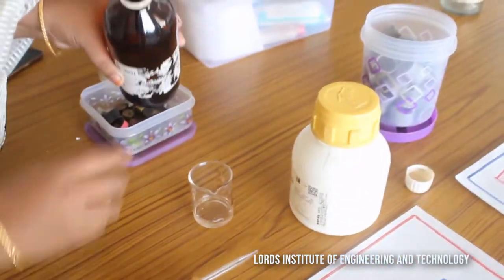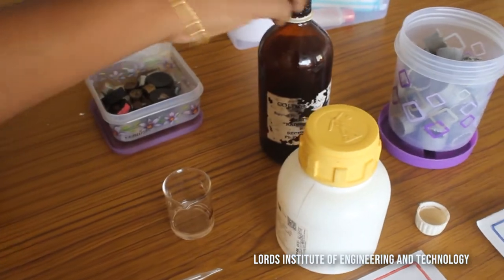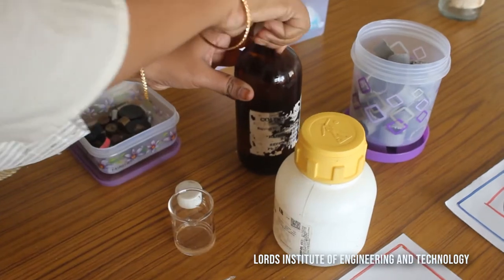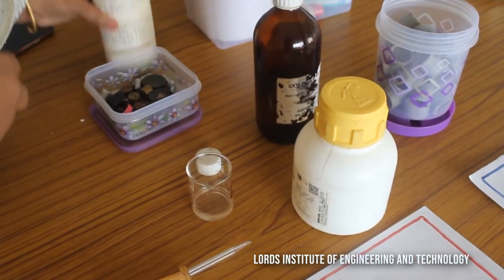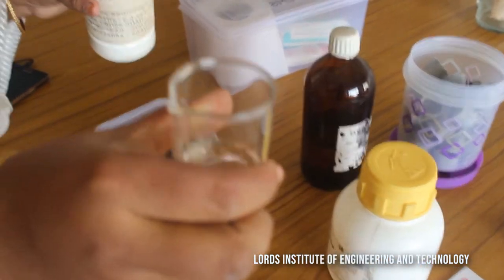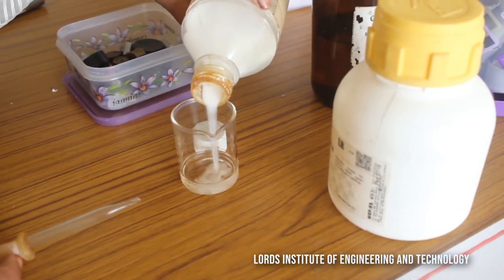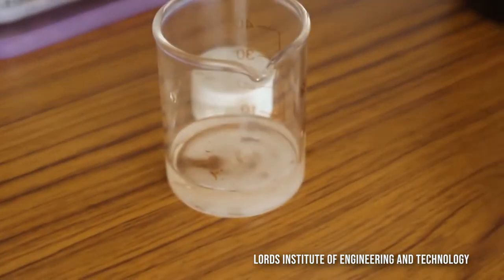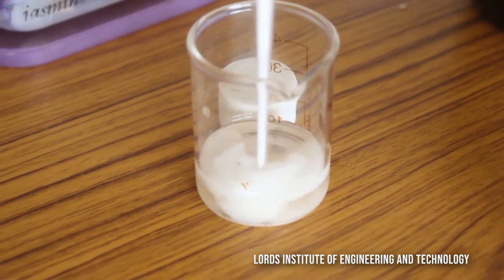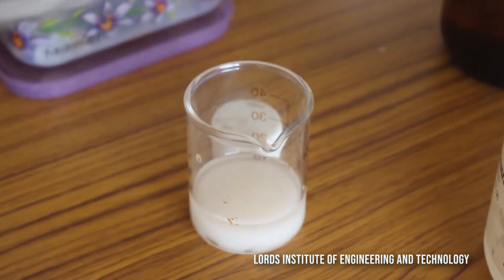This is the cold setting liquid and this is the cold setting powder. If you observe in the beaker, we have taken about 10 ml. You have to mix these in such a way that the mixture is going to solidify easily, as you can see here.